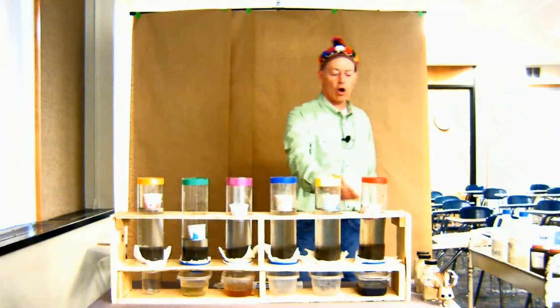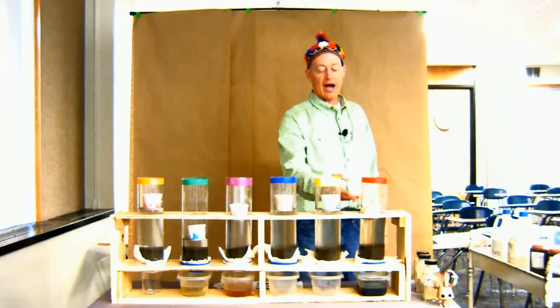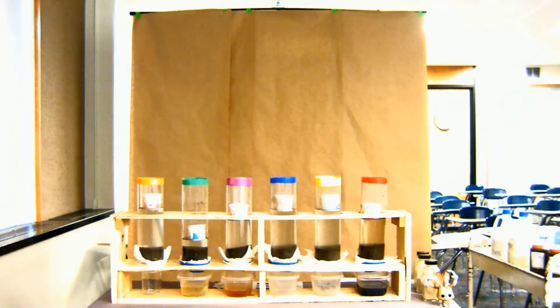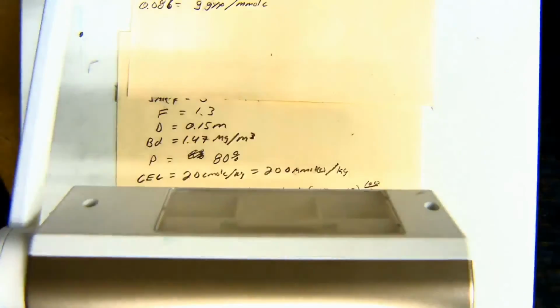Notice how slow this water is now moving. The first one just basically went through without any issues. Now we've created a Sodic soil. So this can happen if you use irrigation water that doesn't have good quality, if it has a low electrical conductivity and a lot of sodium in it.